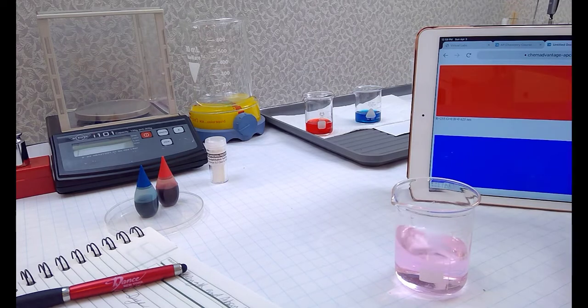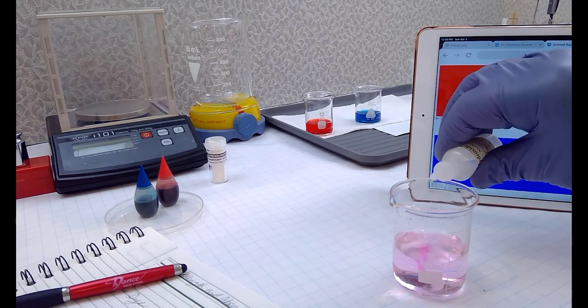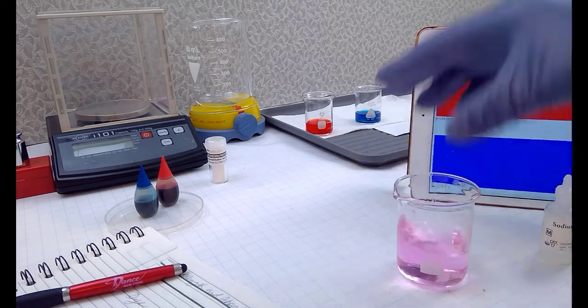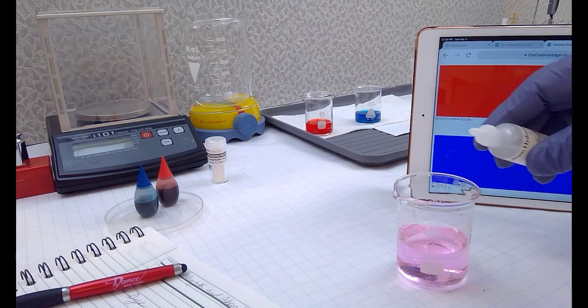It's an acid-base indicator. When its proton is removed from it, it ends up having this just beautiful pink color. One of my favorites. Now you can reverse this. You can put the proton back onto this indicator and the conjugated bonds reform, and you'll get back to a colorless solution. Let me go back to here and add some hydrochloric acid.